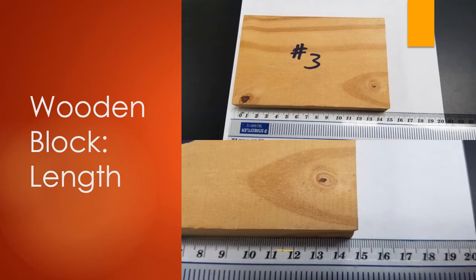Looking at this picture close up, it looks like this block is approximately 14.5 centimeters. But you don't want to put 14.5. You want to go one past that. Is it a little longer than 14.5 or a little shorter than that 14.5 dash? I would say it's a little bit longer than the 14.5.